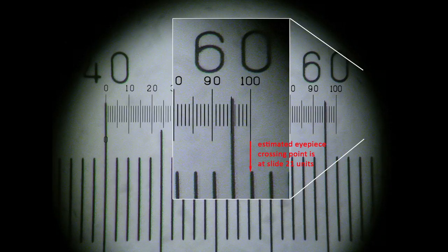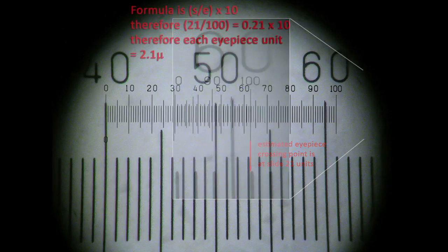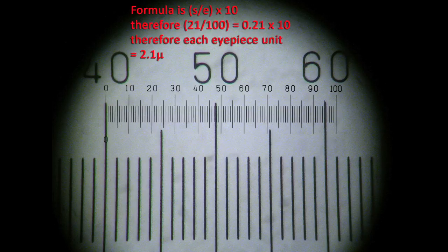So if the formula is applied again, we obtain a value for each IP unit for this particular 40x objective of 2.1 microns.